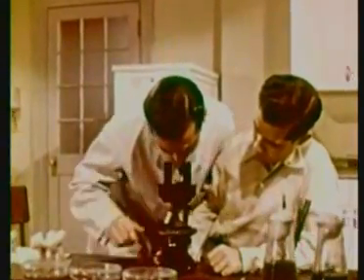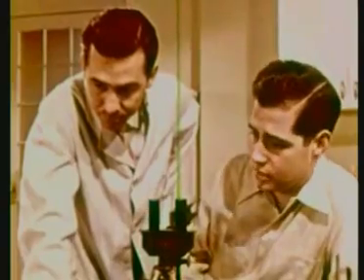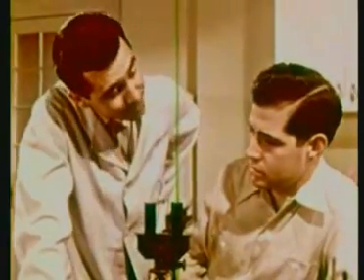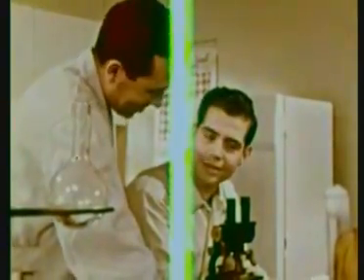Good. You know what kind they are? No. All I know is that they came out of that test tube that you gave me. Then they're one of the kinds of bacteria that cause food to spoil. Ted has just seen one of the many kinds of bacteria.